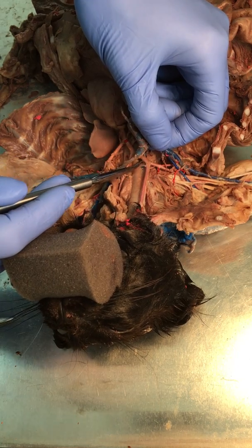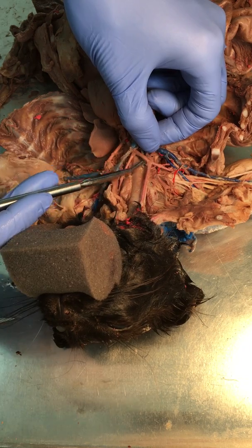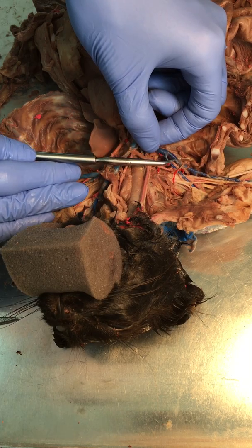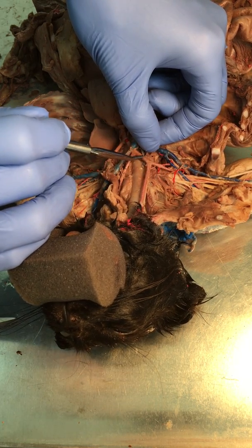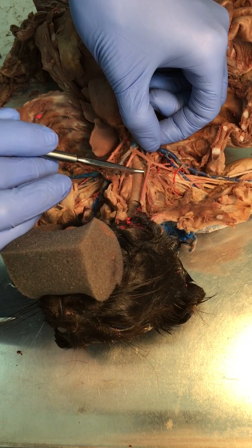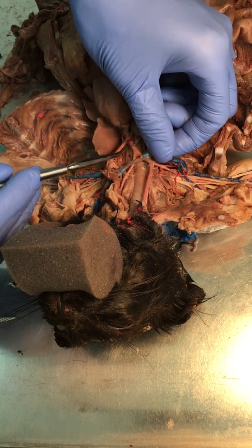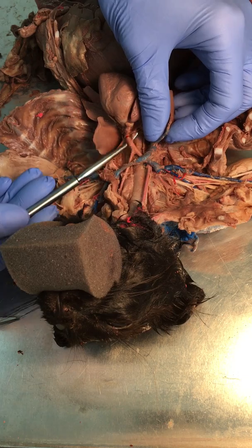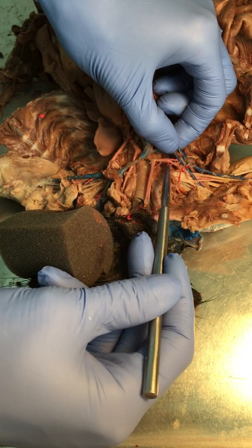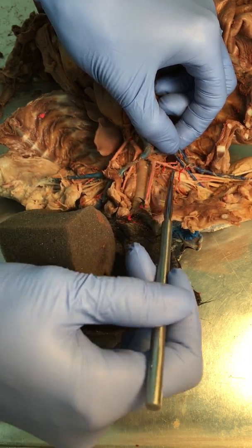All right, so technically I think you could probably also call this subclavian just because of how close these are together, and it would technically sit right under the clavicle, but we're not going to pin something that's ambiguous like that. So if it's in this or this, it would be a common carotid. If we are asking for a brachiocephalic trunk, it would be down here. And then if we're asking for subclavian, it would be over here after the branch for the common carotid here.